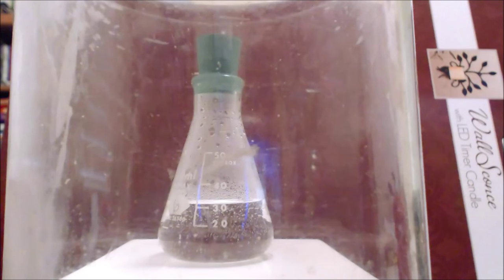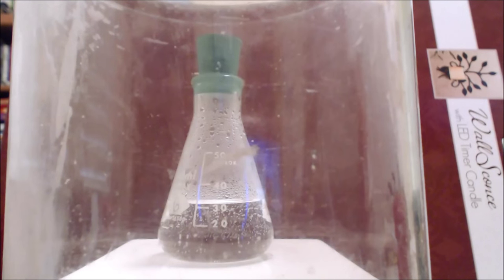And one has to be careful. I have this shielded so it won't hurt me. But as the pressure builds up, it can go above one atmosphere. And the external pressure, of course, is one atmosphere. So eventually, the pressure will be so great that it will cause the rubber stopper to blast off. So we'll let it go for a while and see what happens.